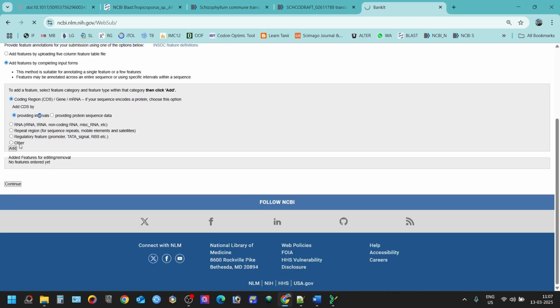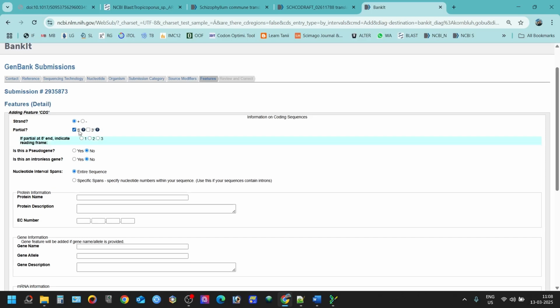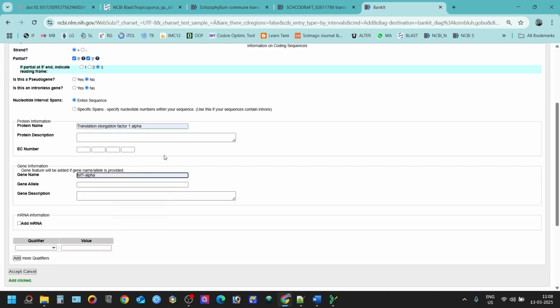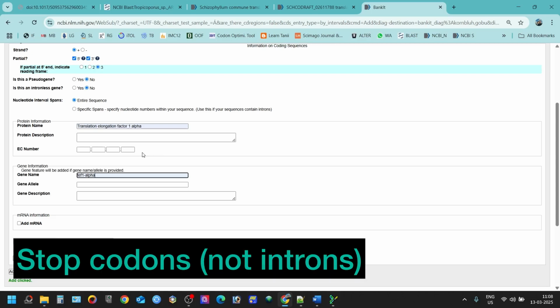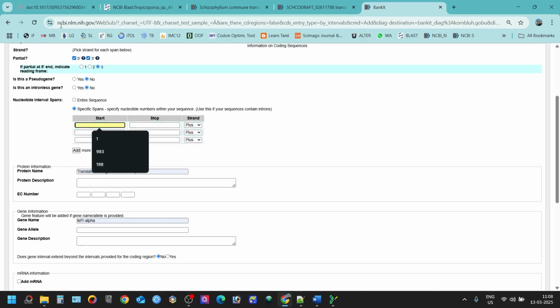So what I'm trying to do is, sometimes the open reading frame that you choose also doesn't work, because that open reading frame also specifies, for some reason, the introns. In that case, you have to change the open reading frame, like what I'm doing right now.